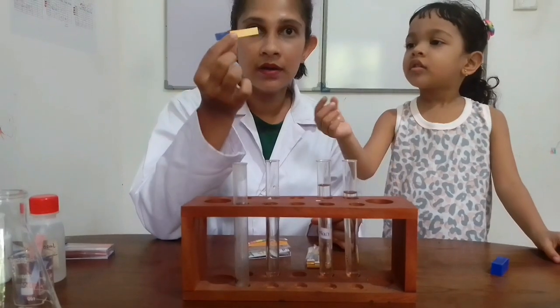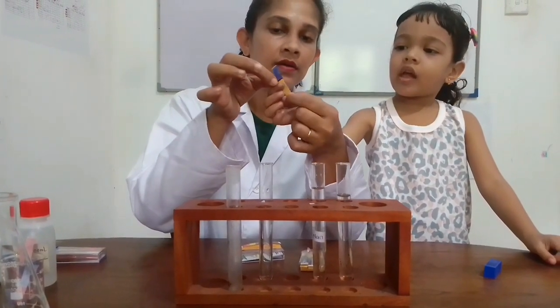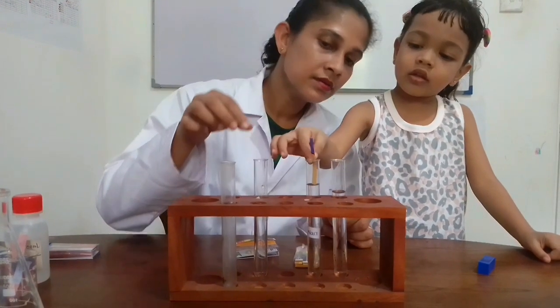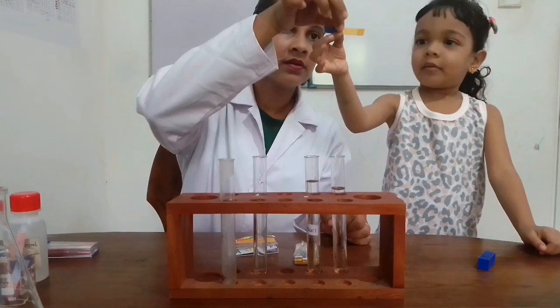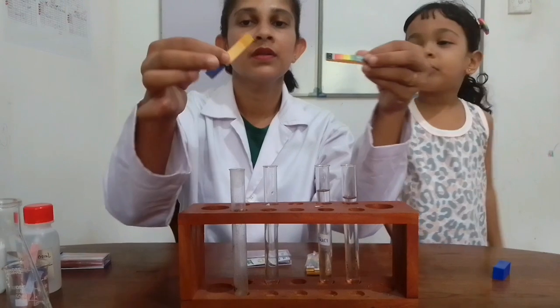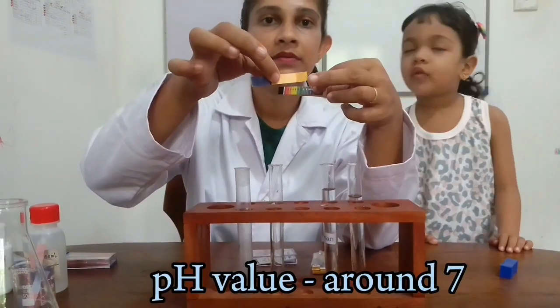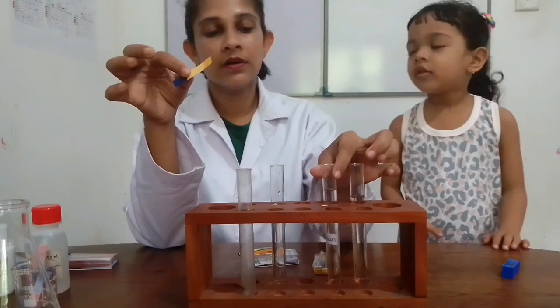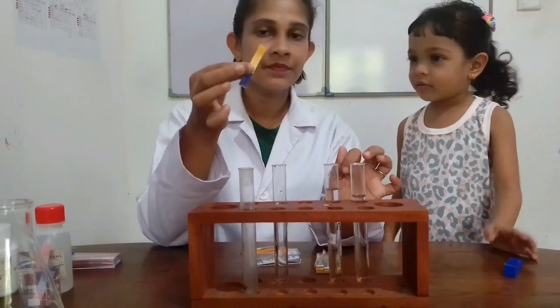Now I am going to use the same pH paper with sodium chloride solution. Other half of the pH paper. Can you see color change? No color change, right? This color of pH paper. With sodium chloride solution, no color change.